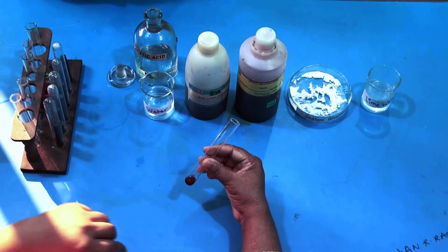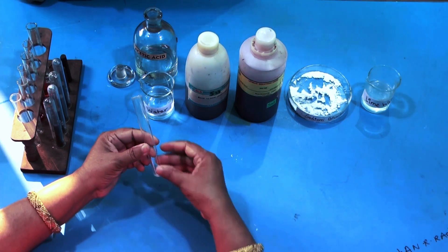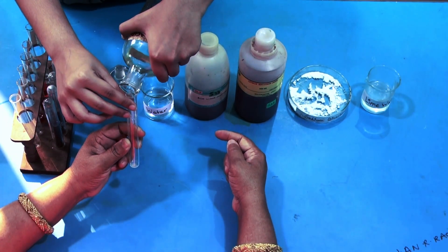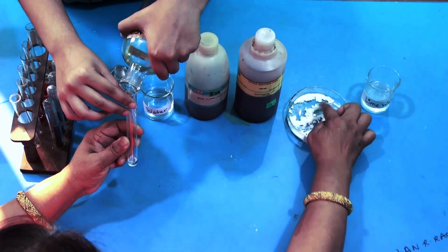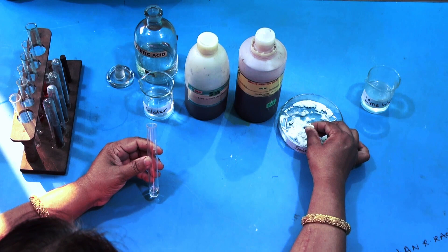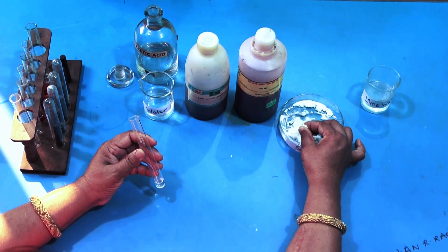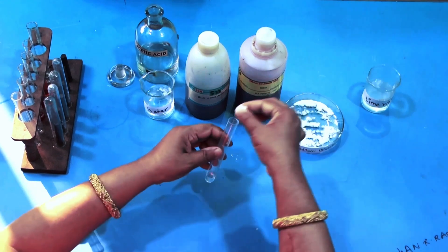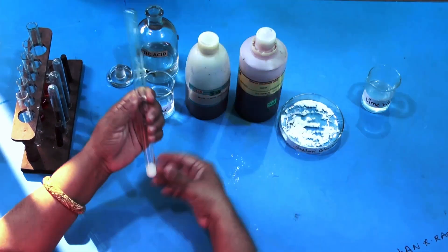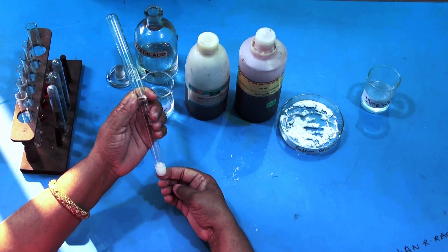Now we will take acetic acid in a test tube and add a pinch of sodium bicarbonate. I want to study the effect of the gas which is evolved when acetic acid reacts with sodium bicarbonate. You can see the bubbles coming out. Acetic acid reacts with sodium bicarbonate and gives out carbon dioxide gas.